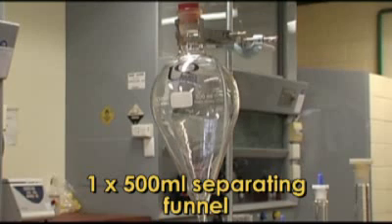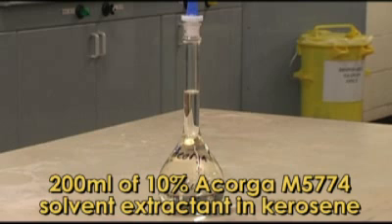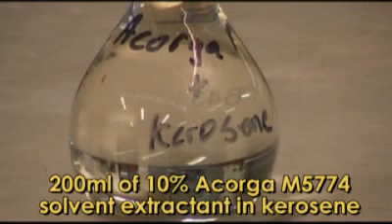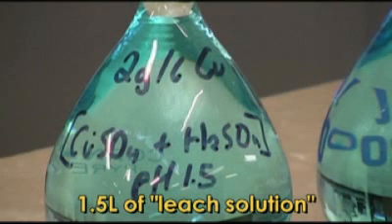This is the equipment and the chemicals that we'll be using in the completion of this experiment. By completing this experiment, you will determine the number of extraction stages that are required to fully load the organic phase with copper. Chemists and metallurgical engineers do this to collect extraction data for varying conditions that may be encountered in the industrial process, and to construct extraction isotherms. They use these isotherms to determine the optimum number of stages needed for the extraction and stripping processes, and to determine how large the reactors need to be.